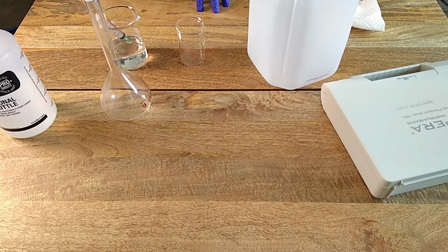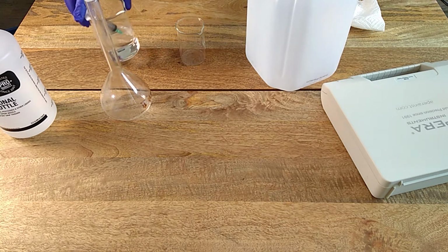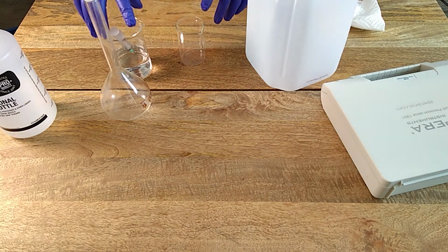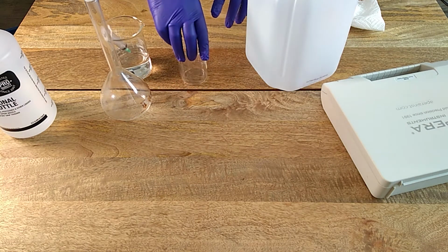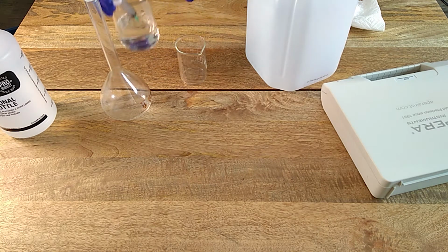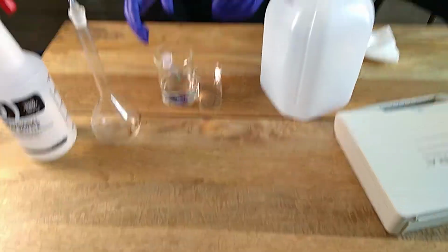Today we're going to be doing a video about the preparation of diluted solutions. As you may know, there are a lot of products in the hydroponic industry that are concentrated solutions: your nutrients, your concentrated foliars, a lot of things that are sold to you. Usually you know that you need to use a certain amount of the concentrated solution with a certain amount of water to reach the desired result.